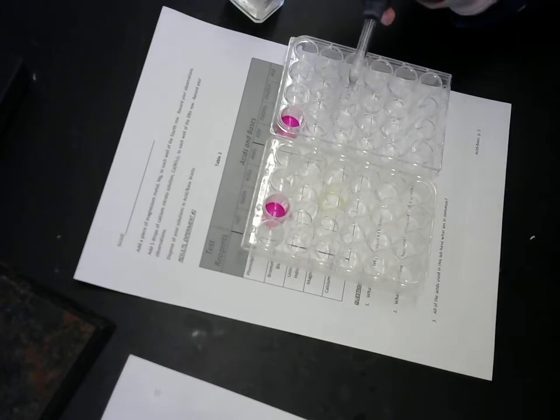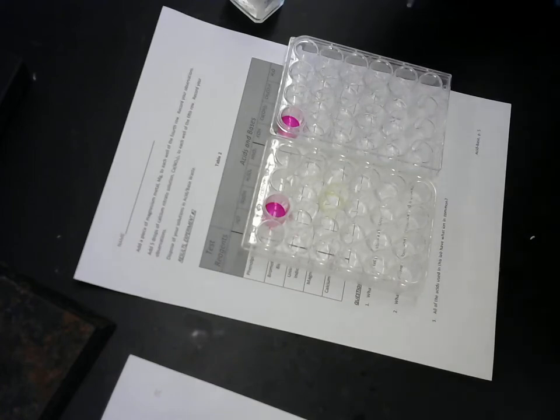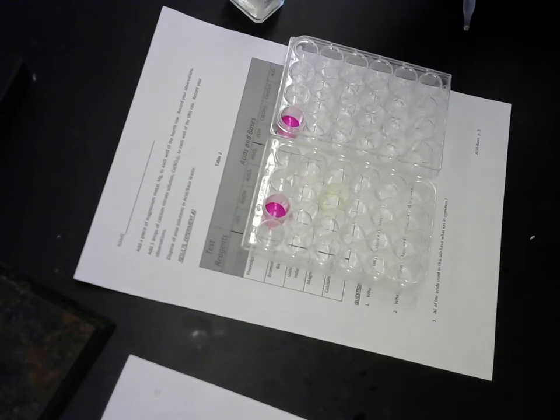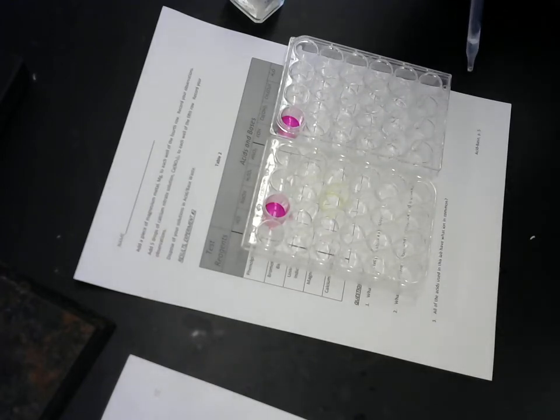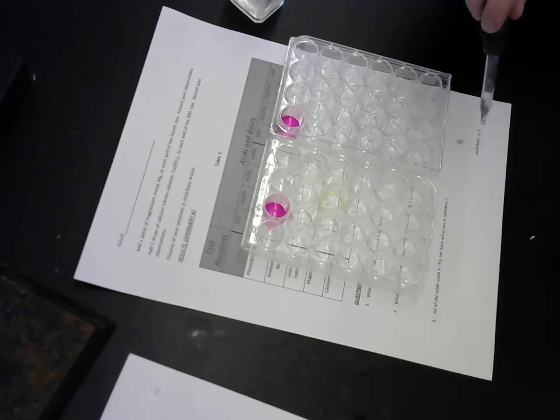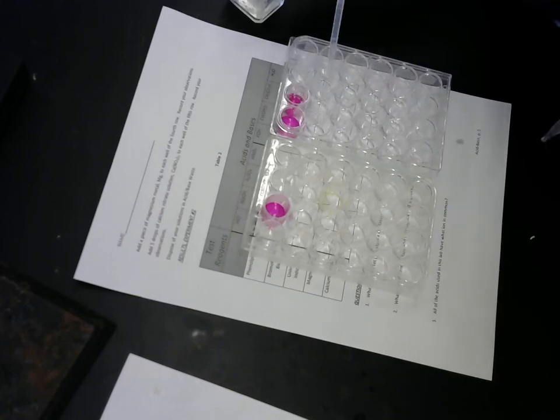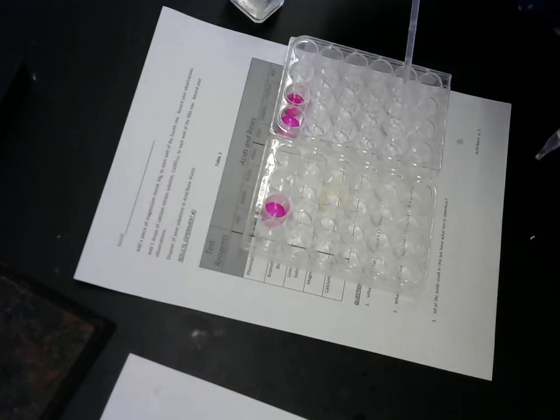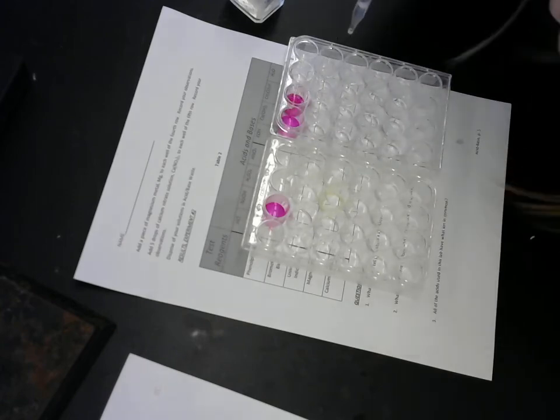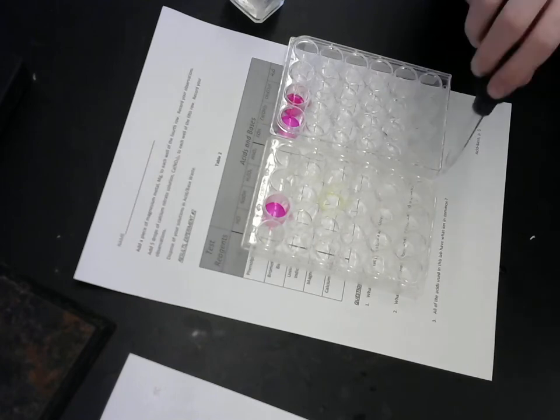Our calcium hydroxide doesn't seem to be working. It's possible I grabbed a low concentration from the stockroom. So I'm going to go ahead and cheat for all of you and make sure that the calcium hydroxide responds in the way that it's supposed to. Excuse me, Lily. Okay, I don't know what the problem was, but I just fixed it. Now there are 3 pinks.